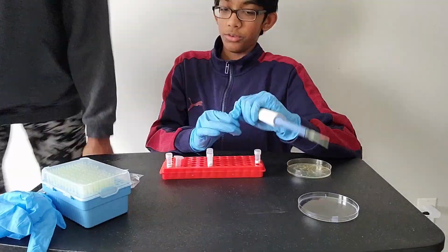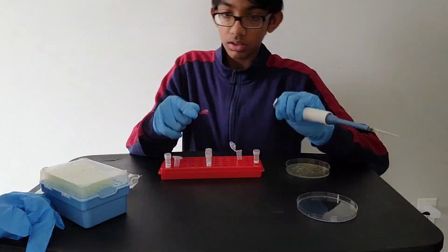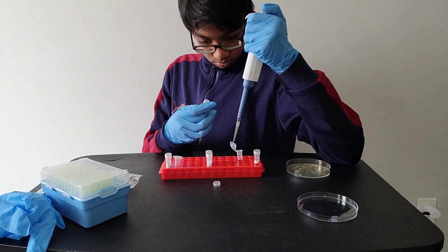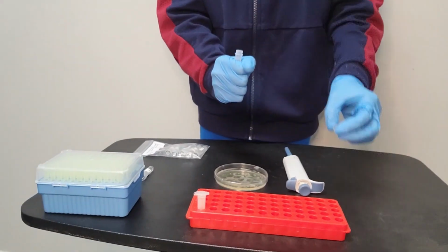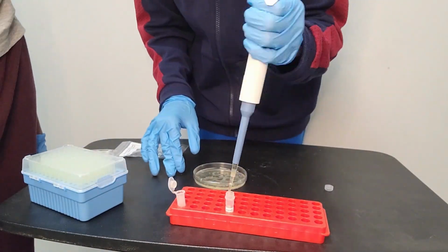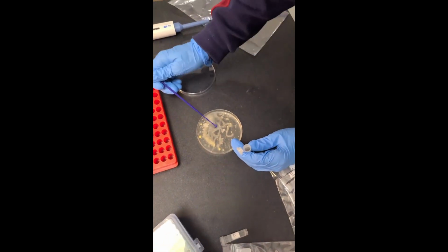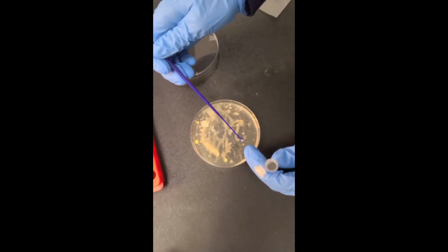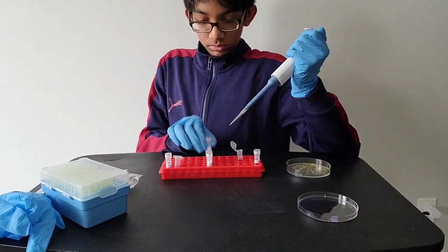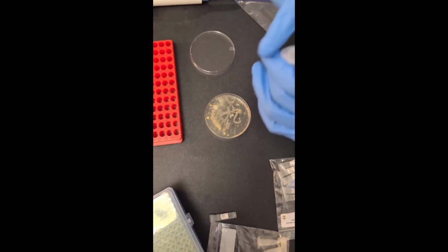Add 55 microliters of sterile water into the tubes containing Cas9 plasmids, gRNA plasmids, and template DNA. Gently shake the solutions and put the tubes aside. To make the competent cell mixture, grab a microcentrifuge tube, pipette 100 microliters of bacterial transformation mix into the tube. Then, using an inoculation loop, take some bacteria from the LB agar plates and add it to the tube. After that, pipette 10 microliters of each of the CRISPR components into the tube. Shake everything together until it is dissolved.